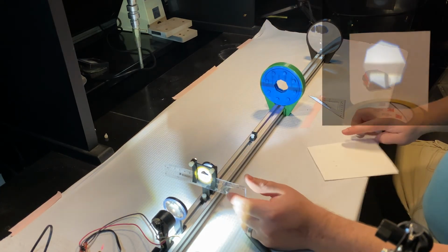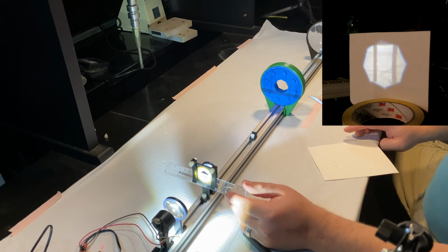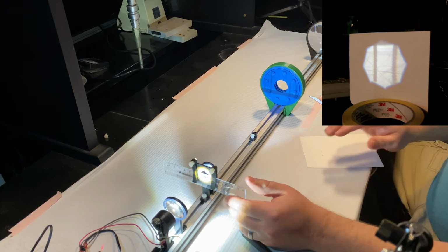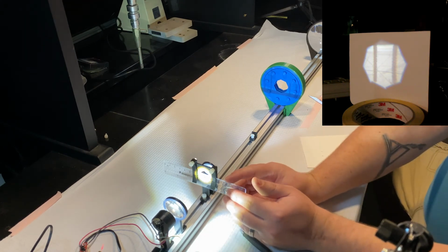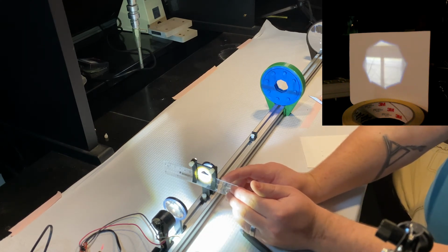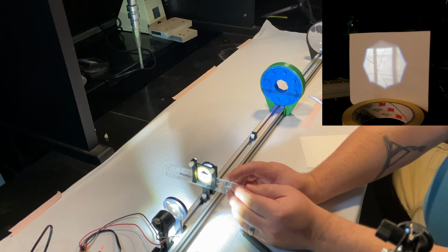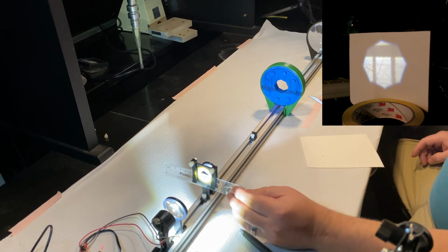But now, let's look downfield again at these two markings that we've been able to fit in our field of view. If I move my sample down, my image also moves down. And if I move my sample up, my image moves up. So that should tell you something about the nature of this image. Is it upright or inverted?